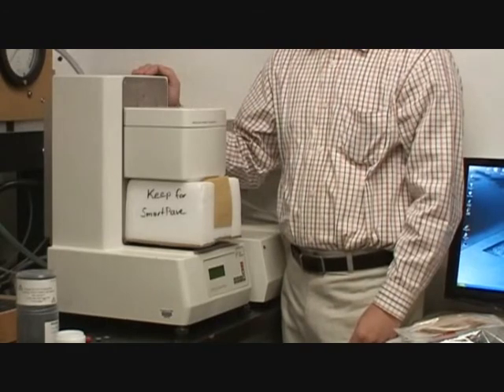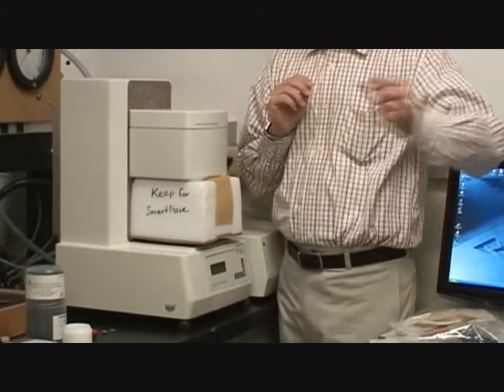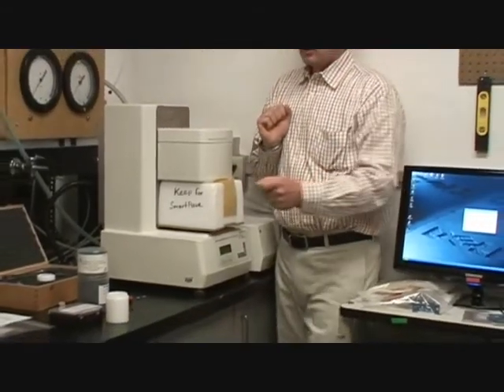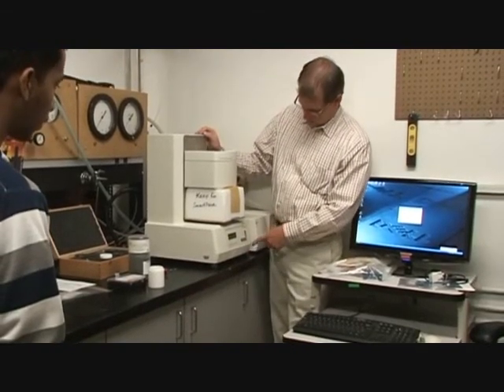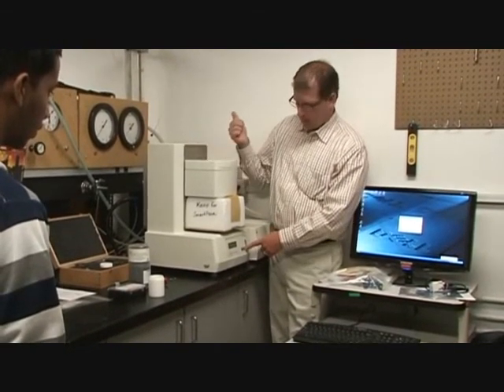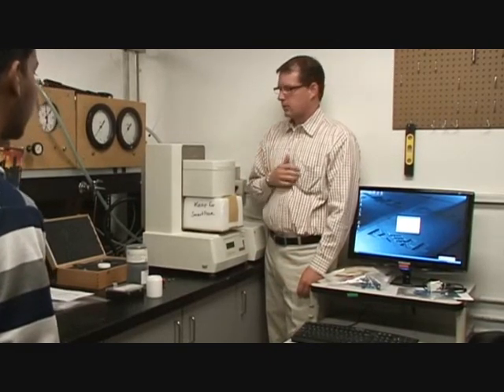So here's a way to store it long term. Or if you need to pick it up and move it from this side of the room to that side of the room, you don't want to do it with just that on, right? When you're done, if you want it to go up, you just hit the reference key. That's going to raise it to the top.